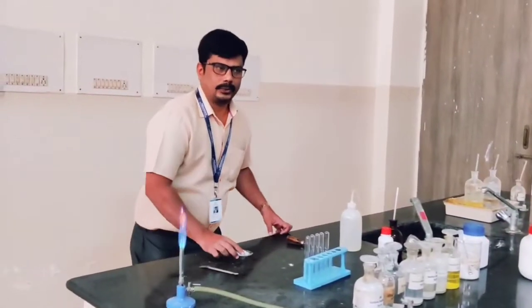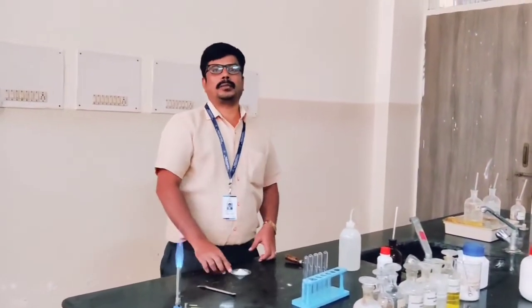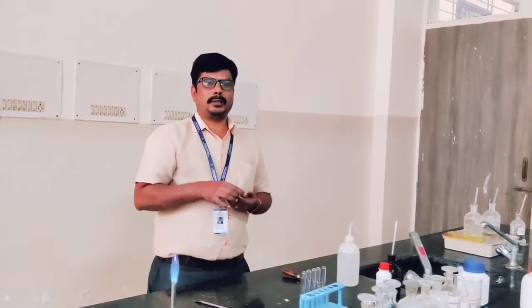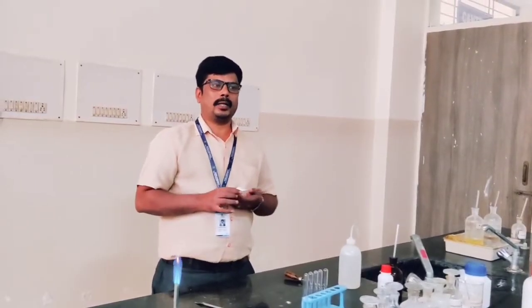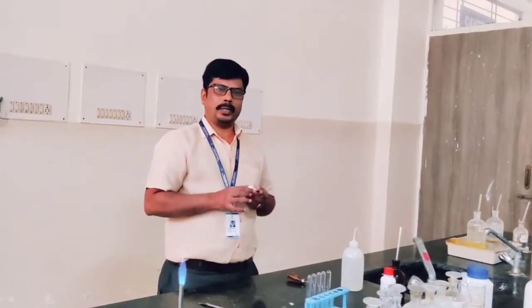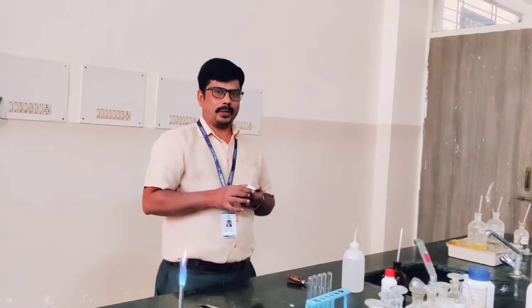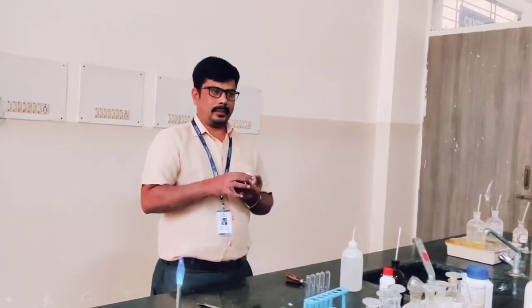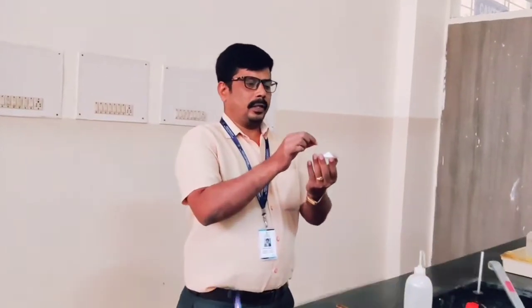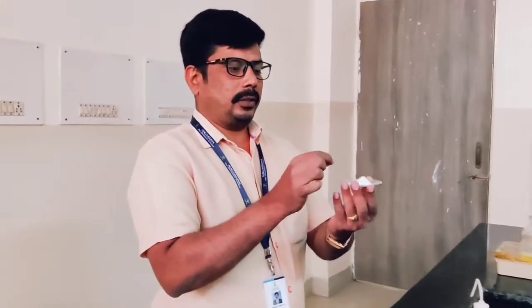Hello friends. I am going to explain how to analyze the acid radical in ammonium bromide salt. Observe here — it is ammonium bromide salt.